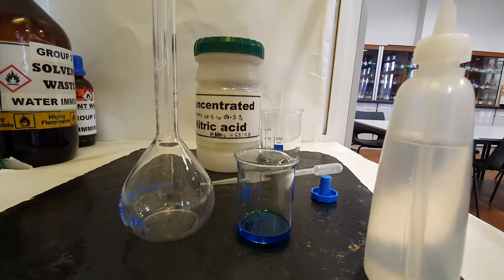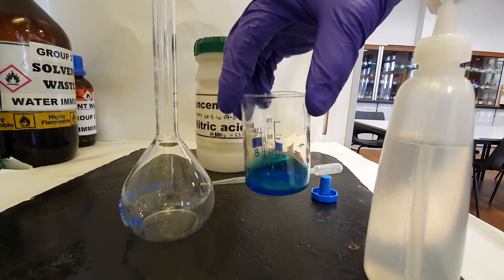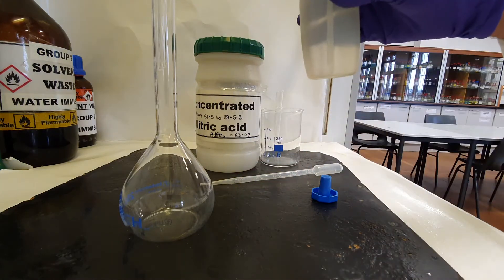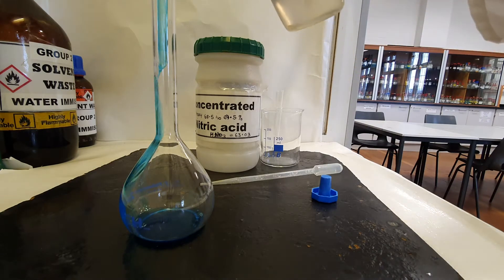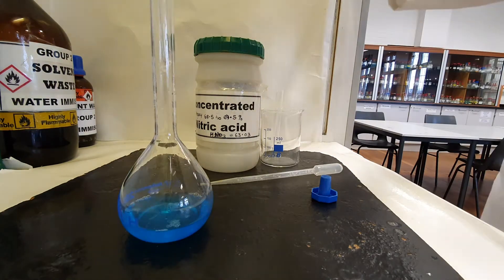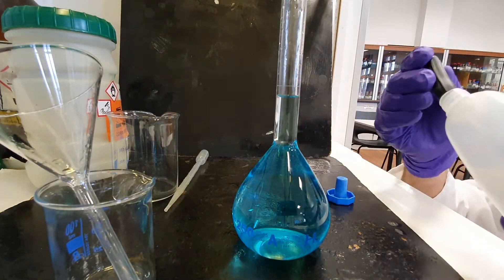The brass screw has now dissolved into the concentrated nitric acid. I'm going to pour this solution into the volumetric flask and make it up to 250 cm³. Using a dropping pipette, carefully make up to the mark using distilled water.